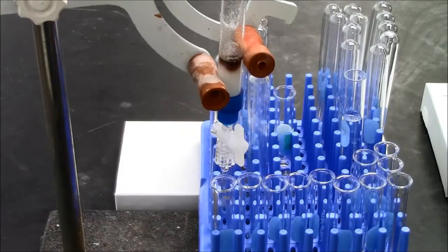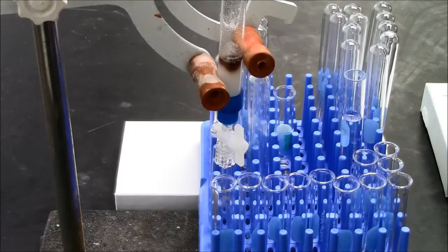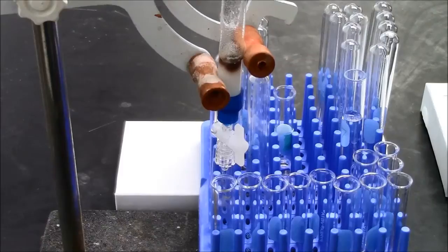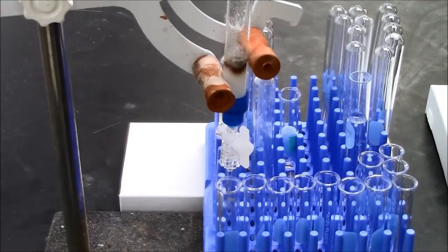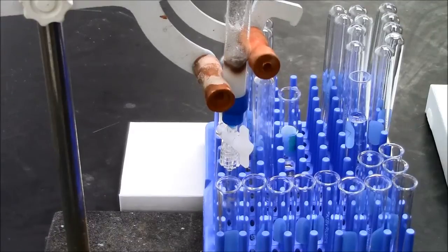I'm expecting these proteins to bind to the column, because at the pH of this buffer these proteins will be negatively charged, and this is an anion exchange resin. So now the protein solution has all gone into the column, into the gel bed.